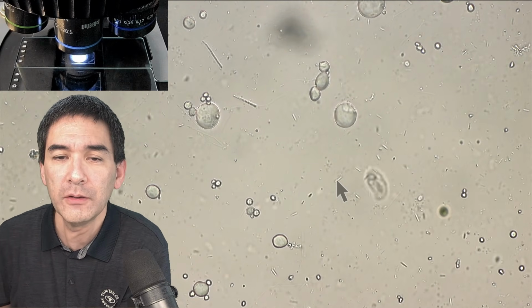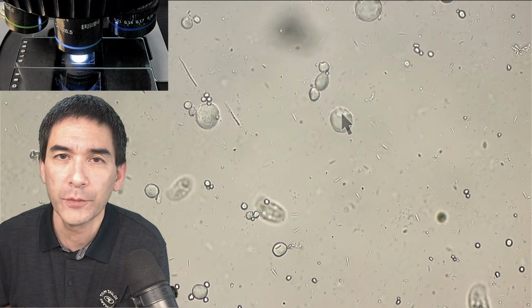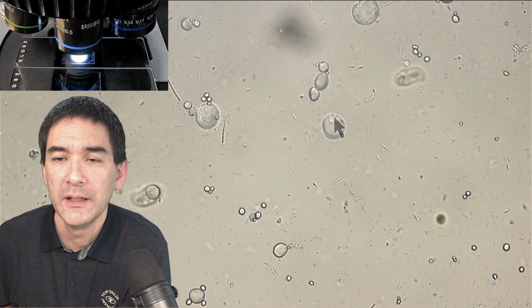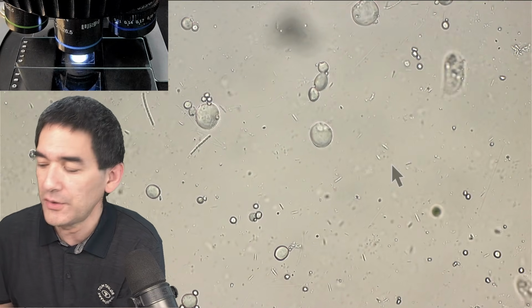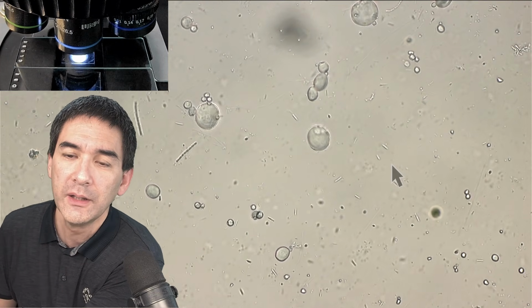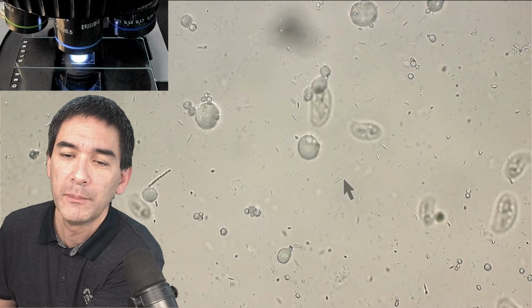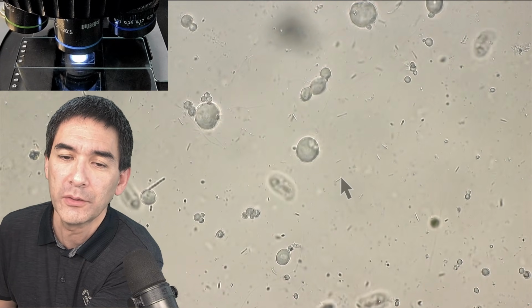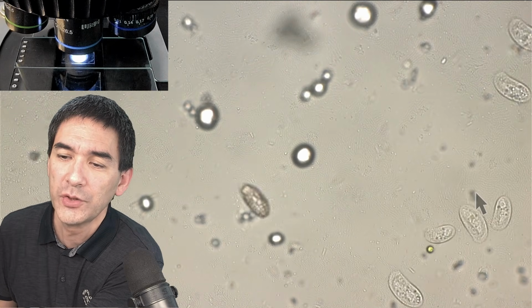And those bacteria are growing because they feed on the starch grains here from the wheat grain that I added. And the ciliates that you see swimming around, they feed again on the bacteria. So what you have is a tiny food chain. And this also shows a little bit the huge size difference between those prokaryotes, those bacteria, compared to the eukaryotes, the ciliates that are swimming around here, which have a nucleus.